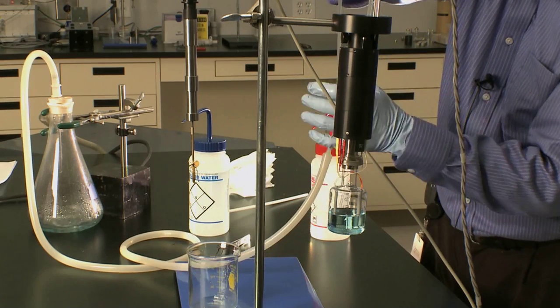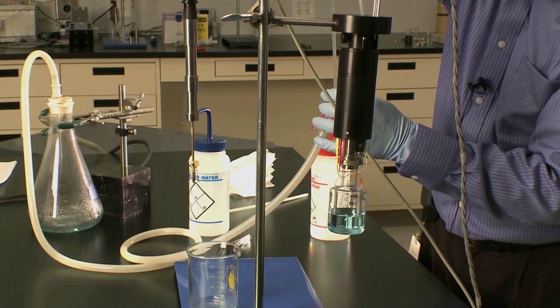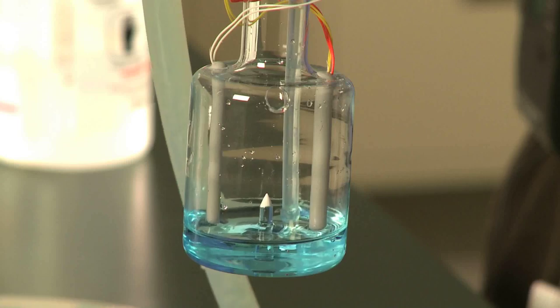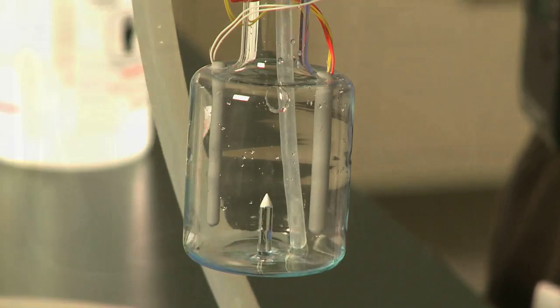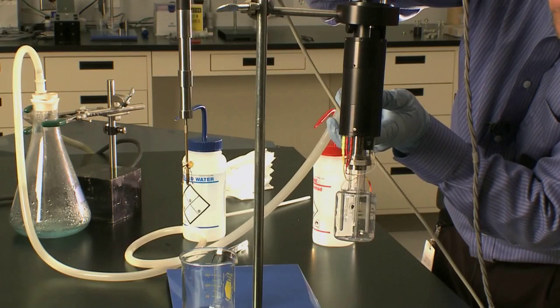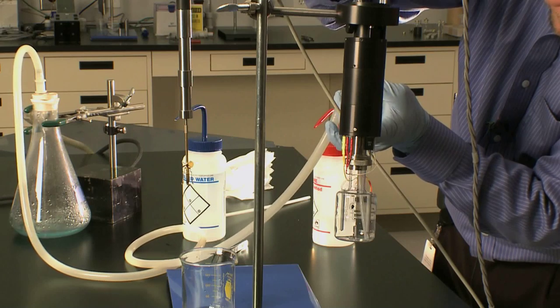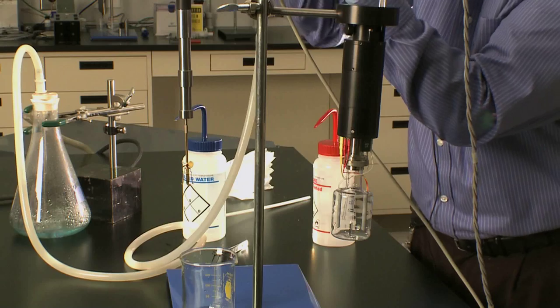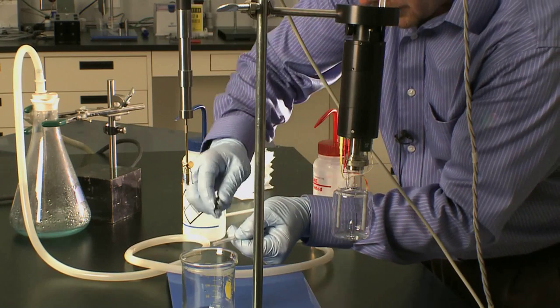Continue to take out the rest of the solution and fish out the remaining glass pieces as you get down to the bottom. You may tilt it to get the solution to go to one side. I think I have the majority of the pieces here, but we'll just clean them off the end.